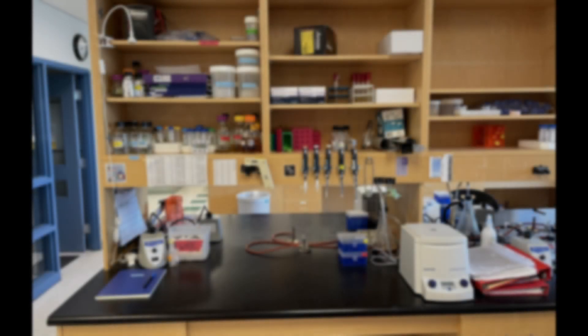Good day fellow scientists and other curious minds. Today's experiment is sodium hydroxide yeast DNA prep.